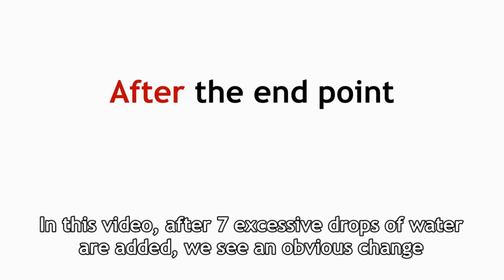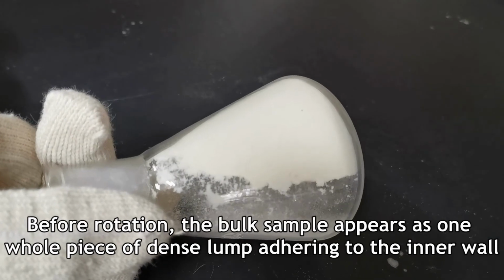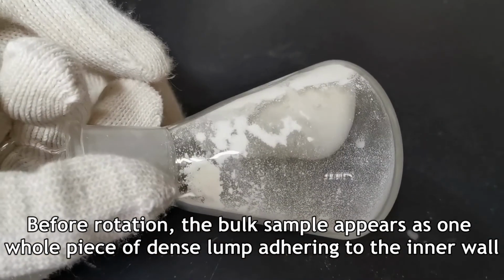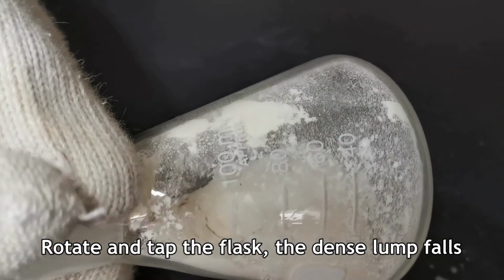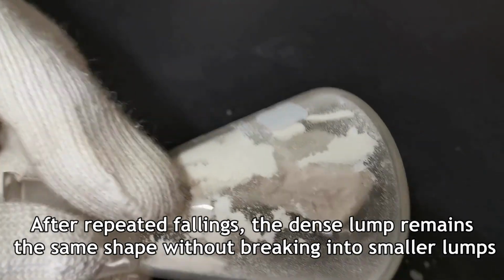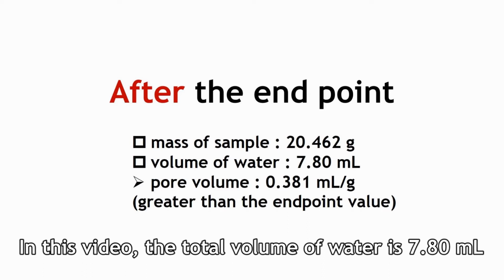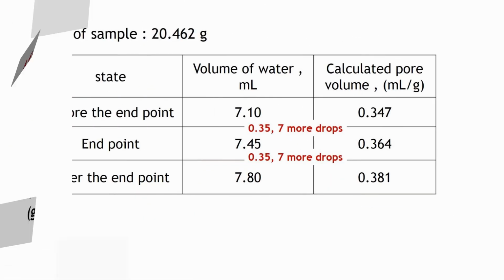In this video, after 7 excessive drops of water are added, we see an obvious change. Before rotation, the bulk sample appears as one whole piece of dense lump adhering to the inner wall. Rotate and tap the flask, the dense lump falls. After repeated fallings, the dense lump remains the same shape without breaking into smaller lumps. In this video, the total volume of water is 7.80 ml, and the calculated pore volume is 0.381 ml per gram, 0.017 greater than the endpoint value.